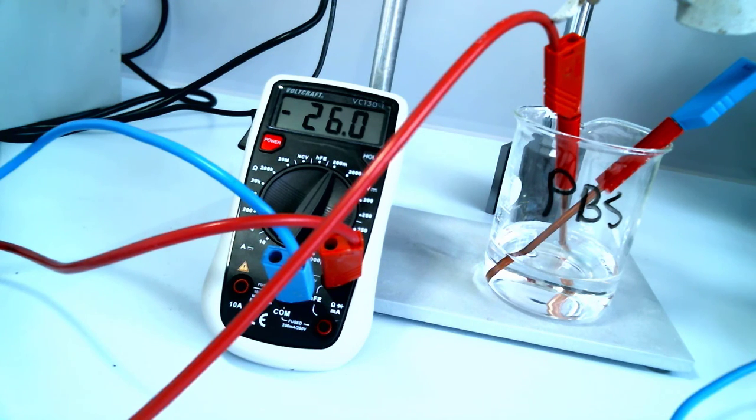As you can see, the difference is going down and down and down as the electrodes become more and more similar because they're really not very good reference electrodes. Right, okay, that'll do.